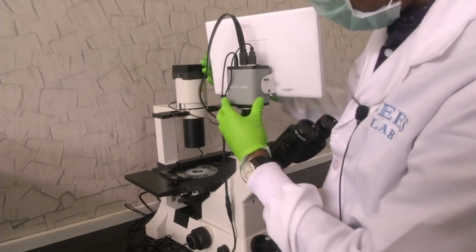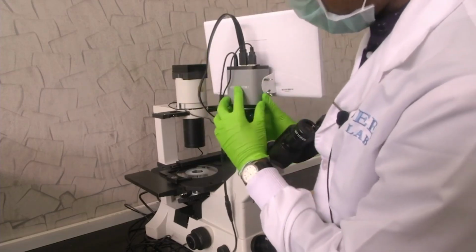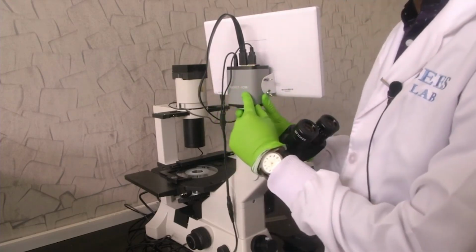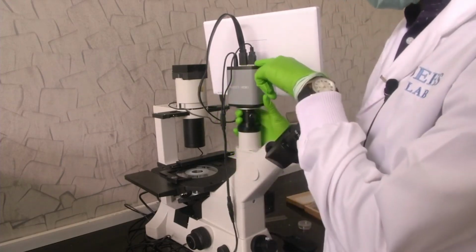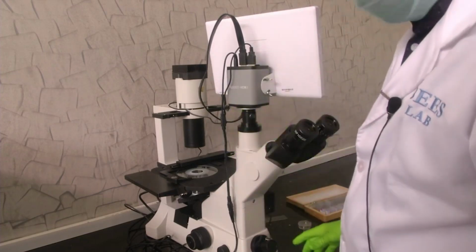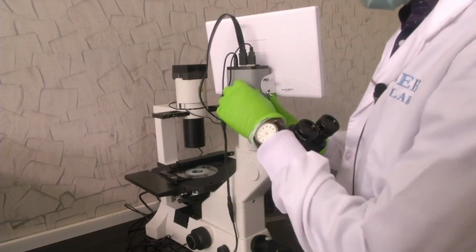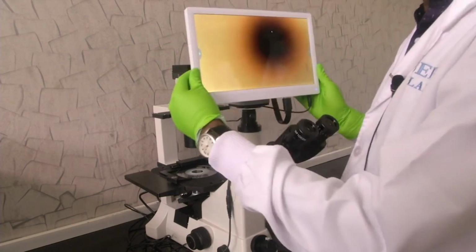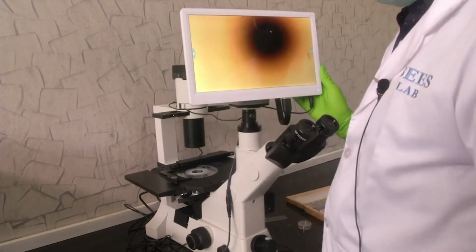We have an HDMI high resolution camera, that is, an HDMI port also on this. There is a USB cable option for it. You can connect a mouse to this, and to this camera we can actually connect a display that has a small OS running on it.